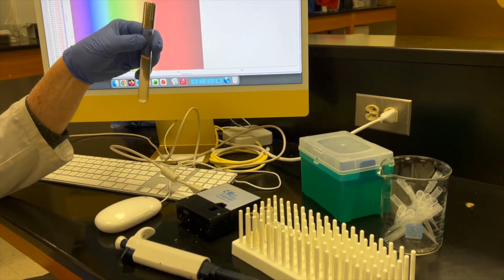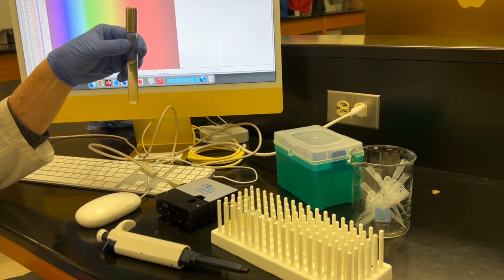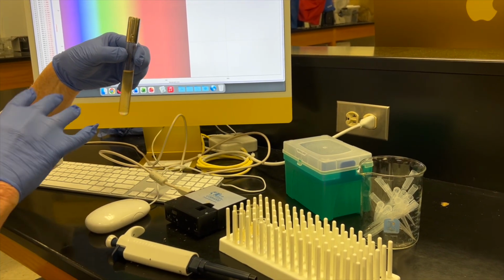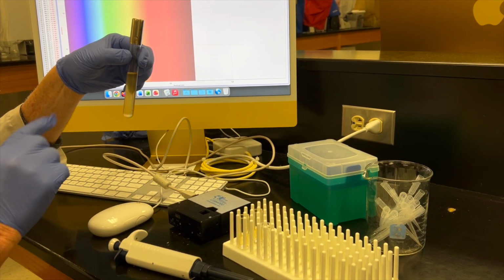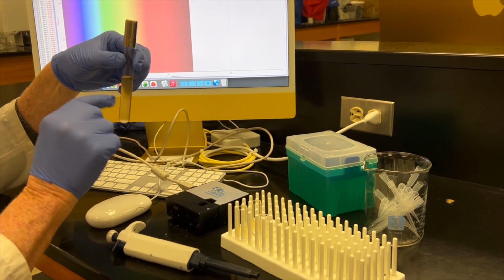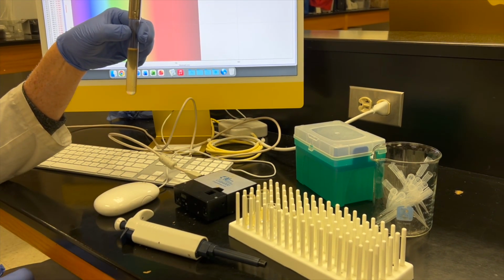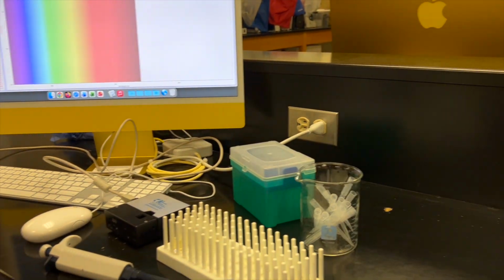Okay, so the last part of the lab. Here's an unknown. We don't know how many bacteria per ml are in here, but we want to figure out how many bacteria per ml are in here. Now, I'm not going to tell you anything. You have all the results from the last lab. I'm just going to run the spectrometer and figure out how many bacteria per ml are in it. So what I did was I took this unknown and I placed 1.5 mLs into this cuvette. This cuvette has my blank broth.